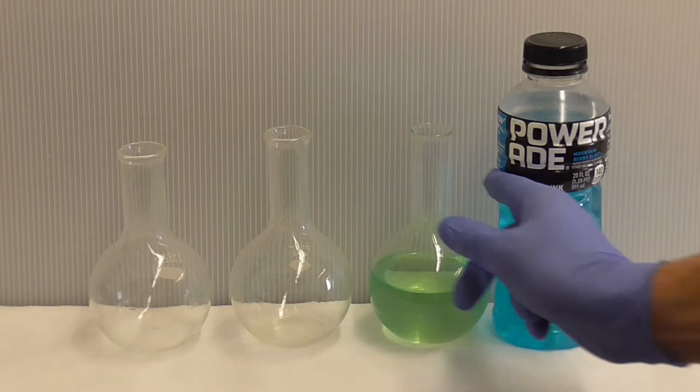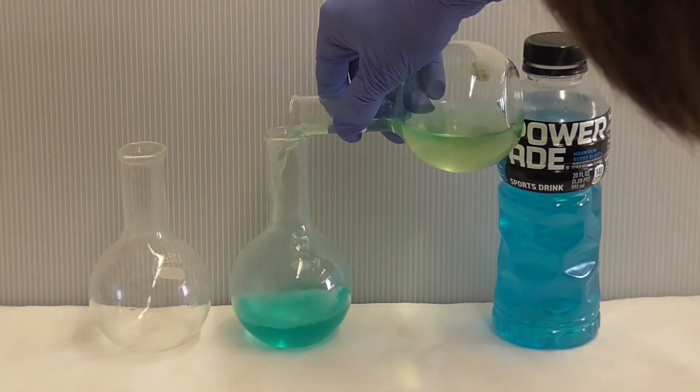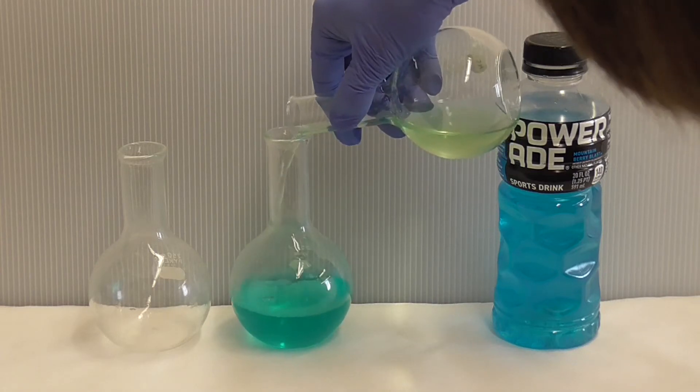I'm going to take this flask here, pour it into the second one. Oh, wow! There's a blue color again! That's cool!